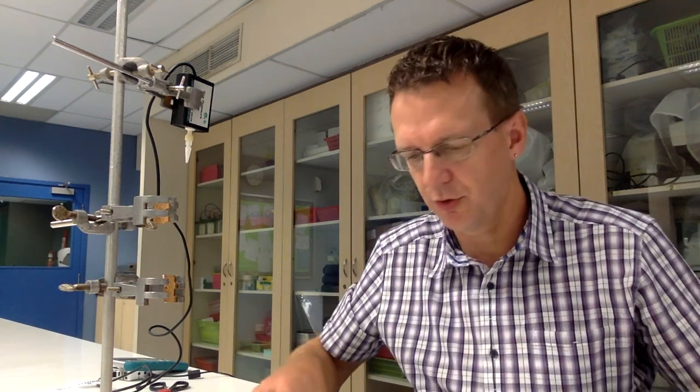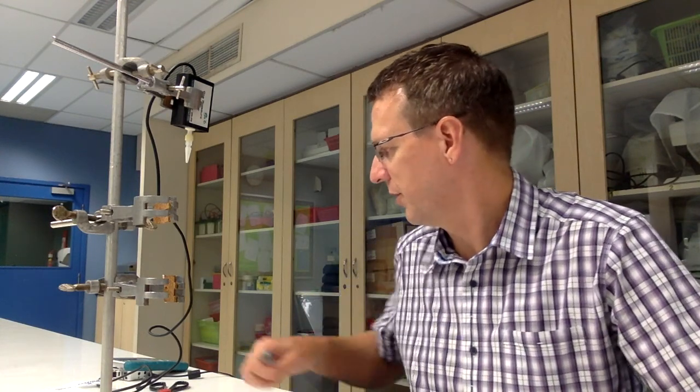Okay, I want to show you how to set up the transpiration lab that we're going to be doing next class. So I've got a number of different things here.